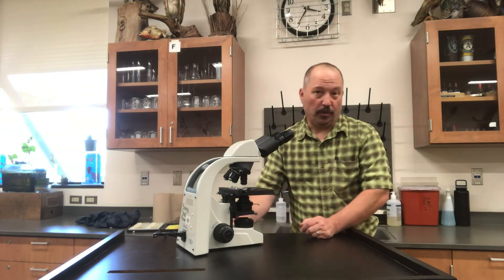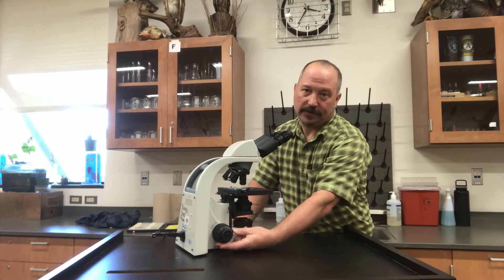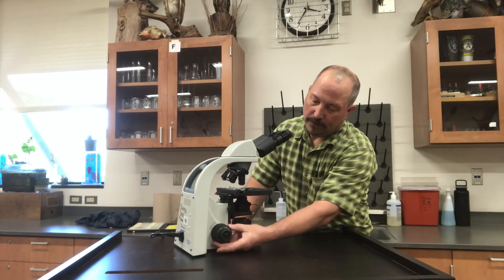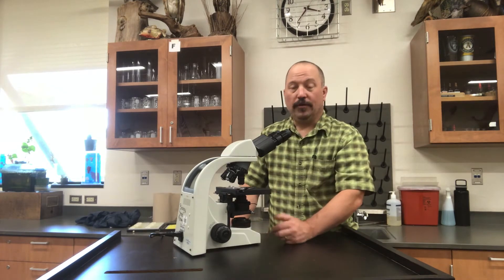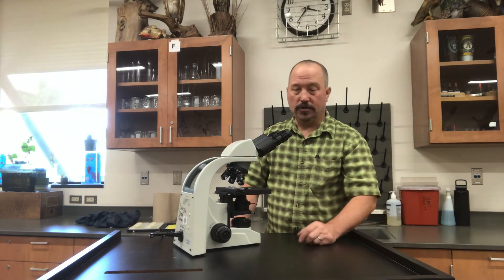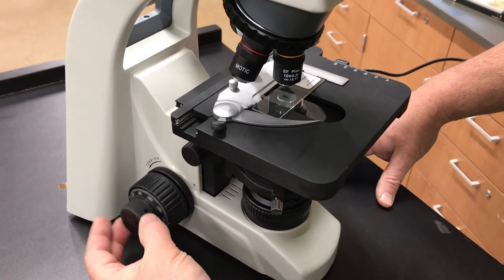You've got your slide in place. Next thing you need to do is put it in focus. The focusing knob is found here on the side. There are two types of focus. The large one close to the base of the microscope is the coarse focus — that's only used on the low power. If you want to look at something closer in the next objective, swing over the objectives to the next one. At that point you can no longer use the coarse focus; you only use the fine focus, which is on top of the coarse focus.